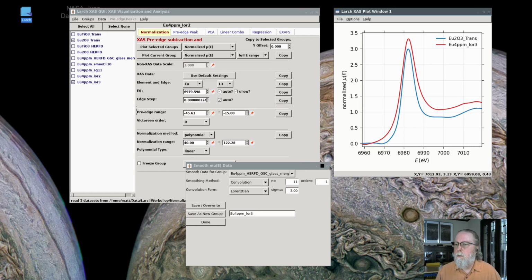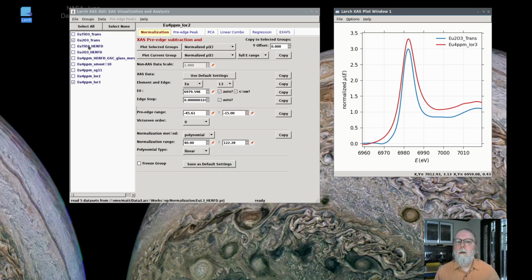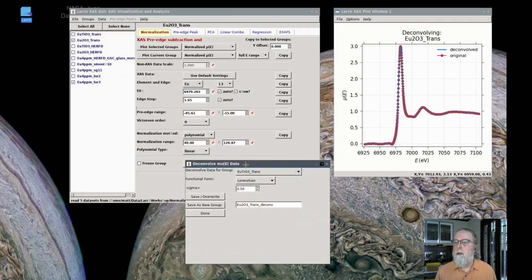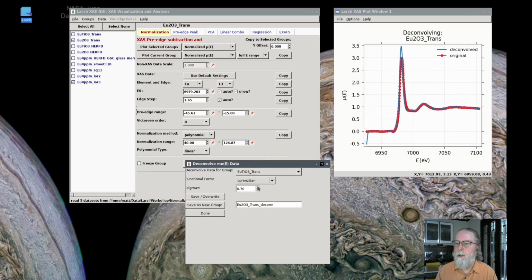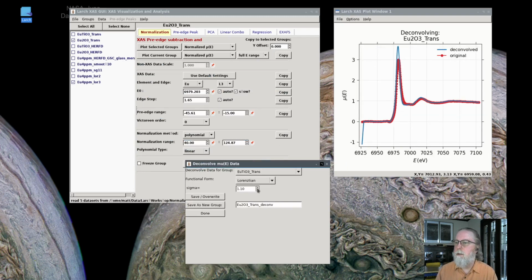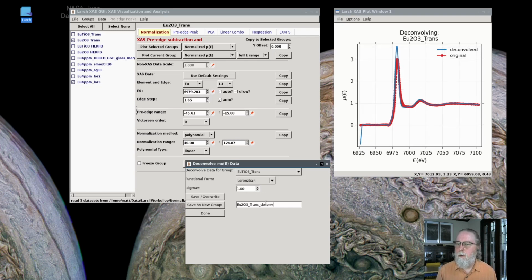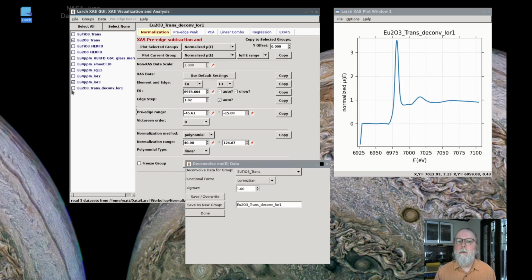We can also go the other way. We can take the transmission data here and ask if we can deconvolve that to make it sharper. If you have fine enough data, you can take a Lorentzian and sharpen the data by deconvolving it with a Lorentzian, say of 1 eV. Just for the sake of simplicity, I'll deconvolve that with a Lorentzian of 1 eV and save that as a new group. Does that better reproduce the HERFD data?